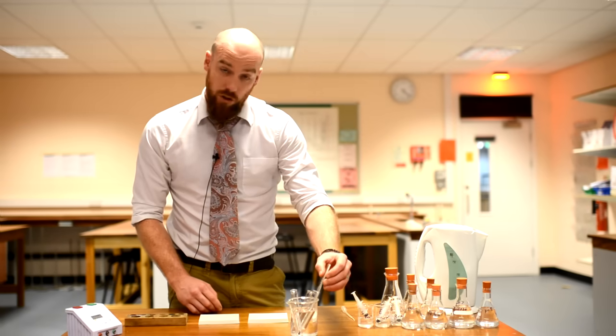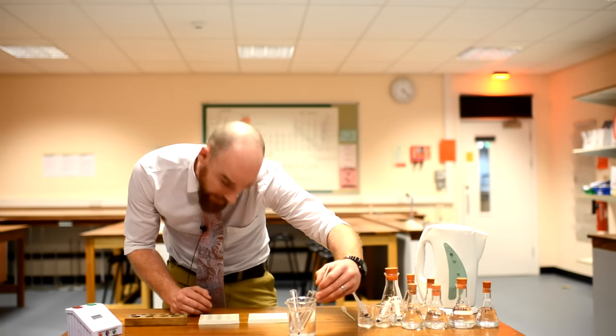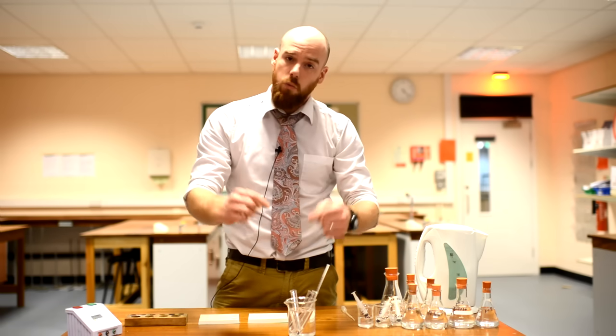After the temperatures of the solutions have adjusted to as close to 30 degrees as you can get them, you need to transfer all three solutions into one test tube.